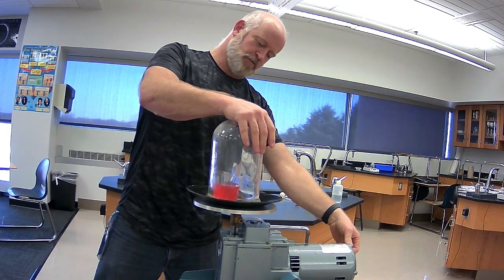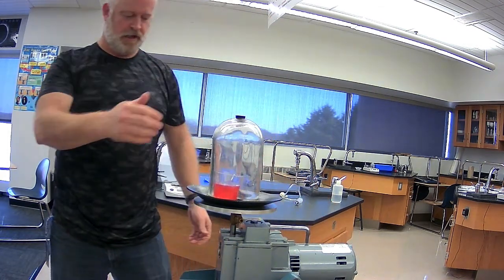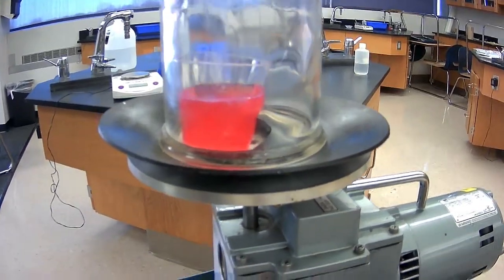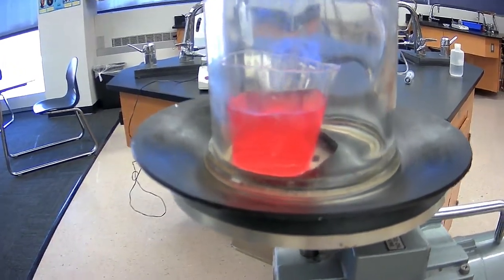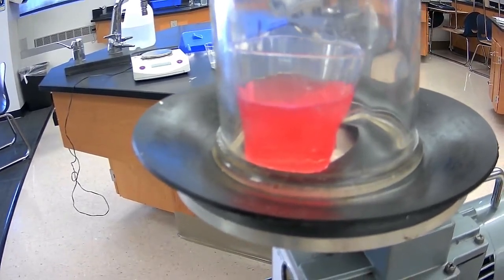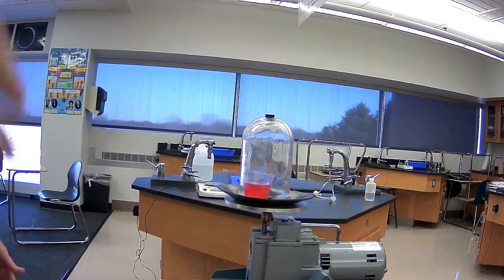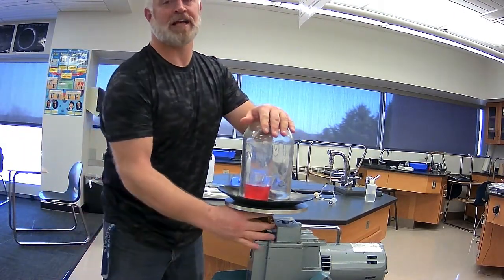and we will decrease pressure. And lo and behold, we have an amazing result of pretty much nothing. Okay, we don't see any solid coming out from the bottom. We don't see any bubbling. There's no precipitation of particles. There's no sugar sitting on the bottom. It pretty much has no bearing on this solubility, which should align with what we know about how pressure affects solids or liquid solutes.